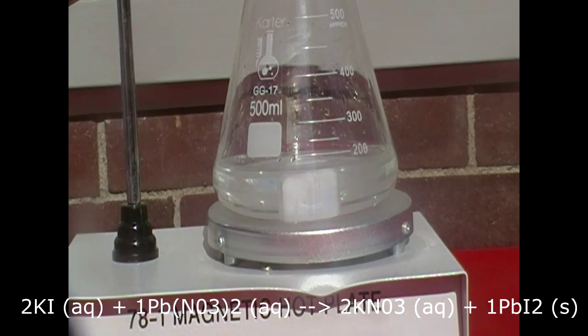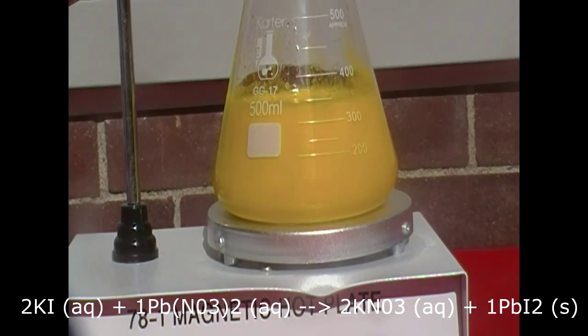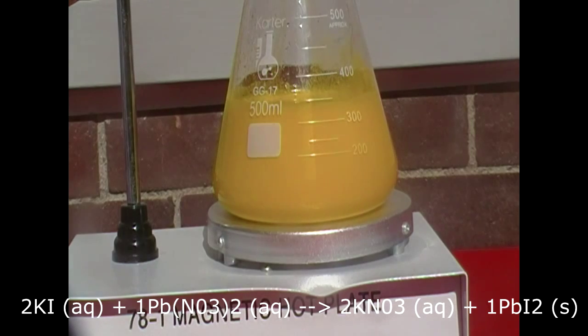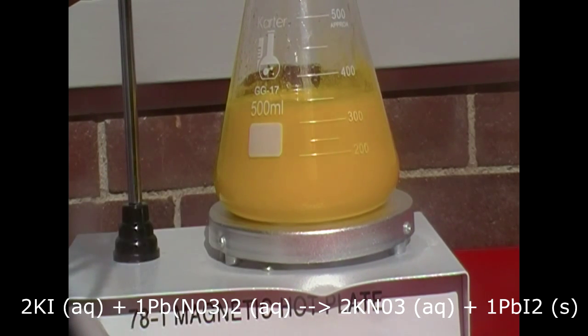Now we add it in, and it's bright yellow. It looks really disgusting, but it's really cool to look at. You have to admit that. You know I have to be right with that. Just look at it. It's so interesting. It really is.